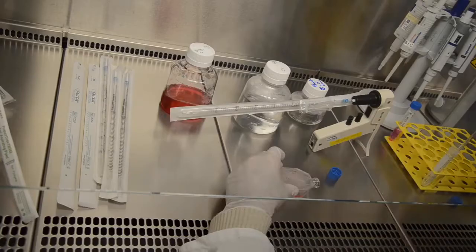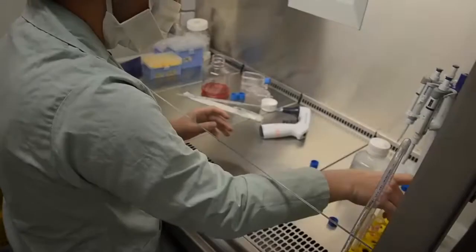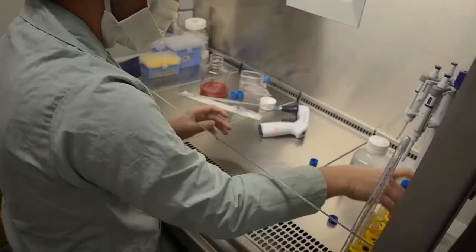Then it is time to seed the cells into the wells. First, we need to detach our cells of interest from their culturing flask using standard protocol, in our case with trypsin. We then resuspend the cells in warm culture media and concentrate the solution to have a final cell concentration between 200,000 and 1,000,000 cells per milliliter according to the number of cells we target per well. For the seeding process, we just have to remove the culture media from our SOSPIN device and pour one or two drops of our cell solution on top of the well. Gravity will do the rest and the cells will fall down into the wells, as we can see after 10–15 minutes of incubation.